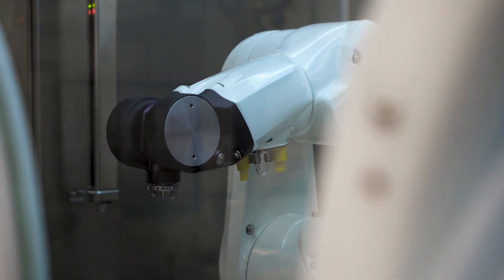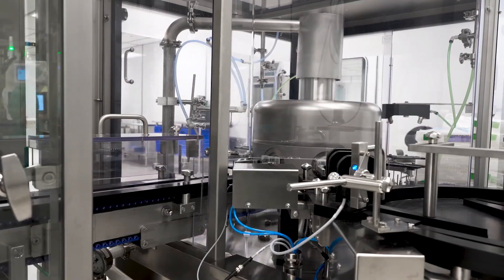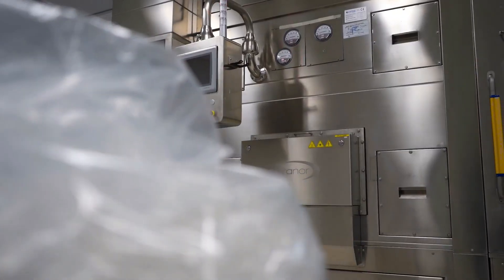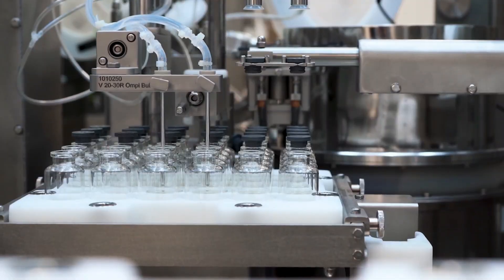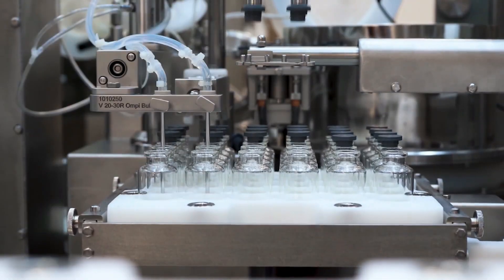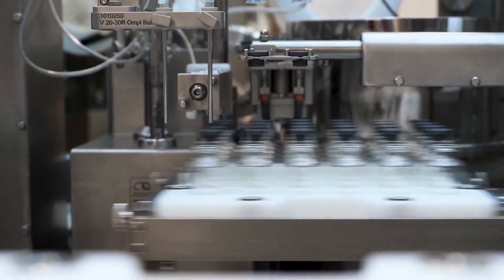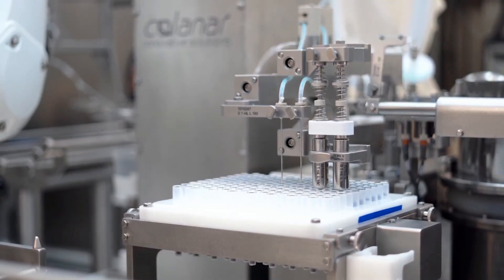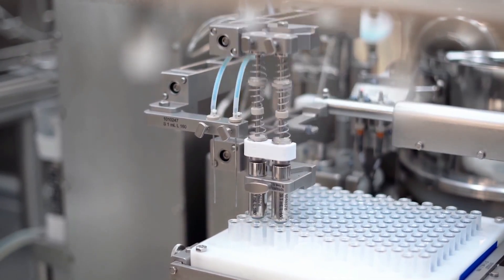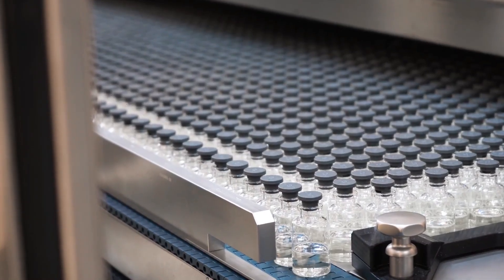Here's an overview of filling isolator operations. Aseptic filling process — product transfer: sterile products and components, e.g., vials, stoppers, are introduced into the isolator through validated transfer mechanisms to maintain sterility.